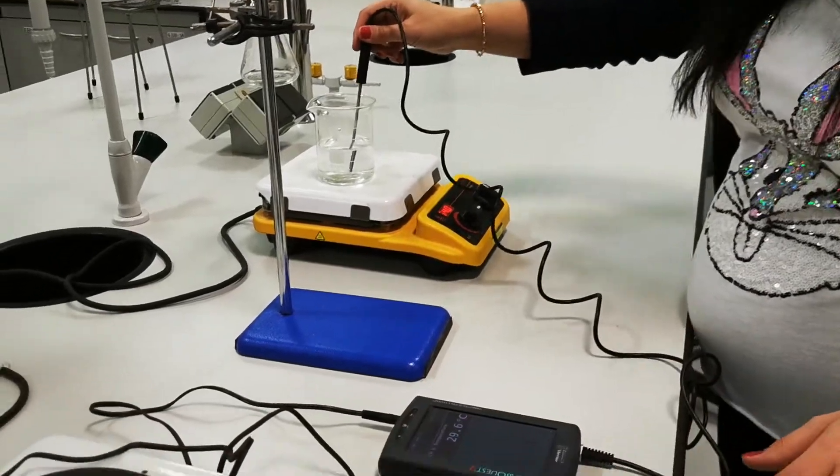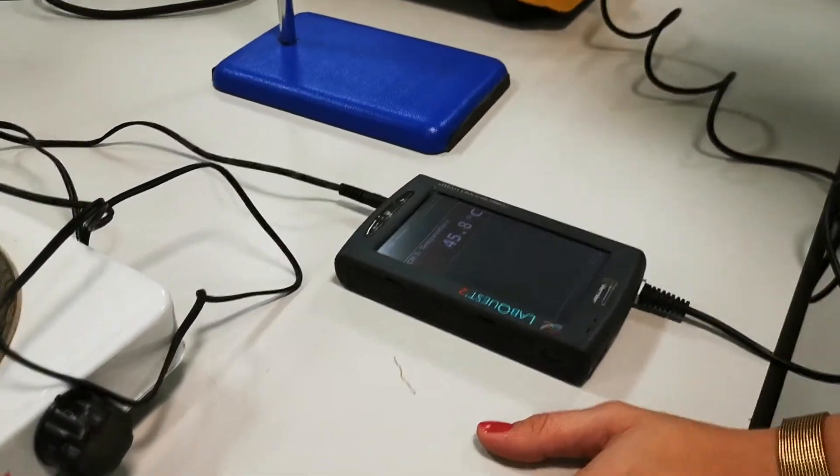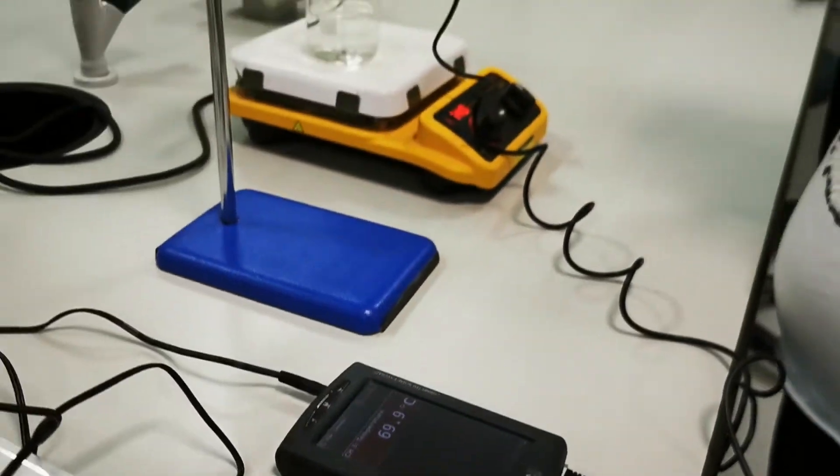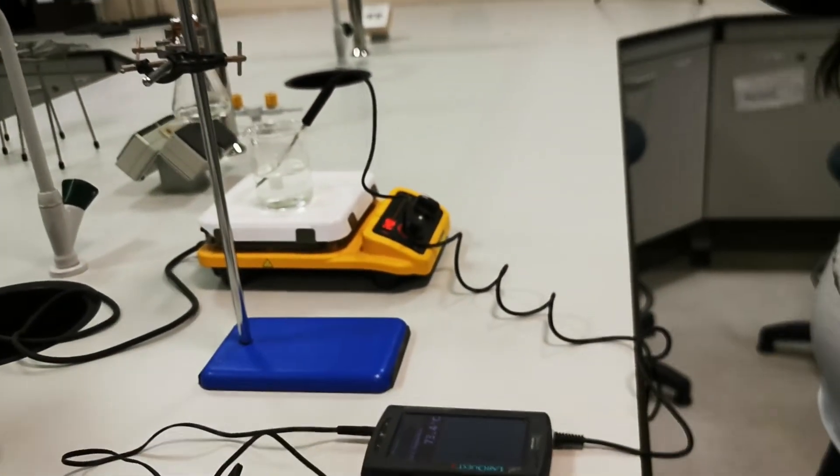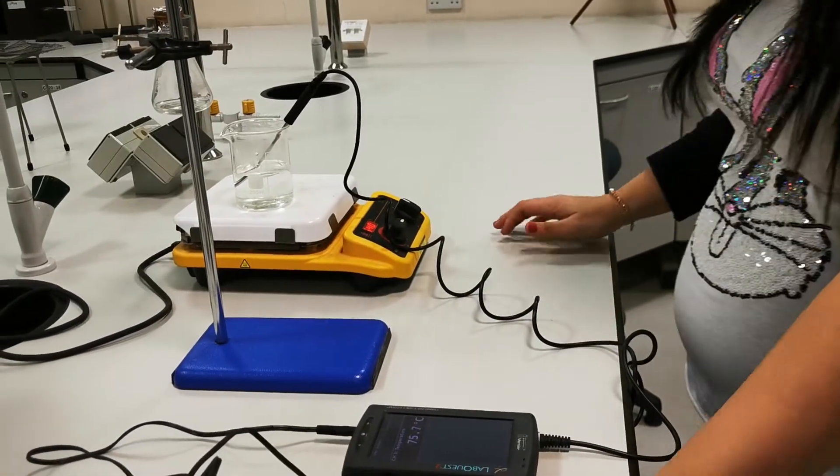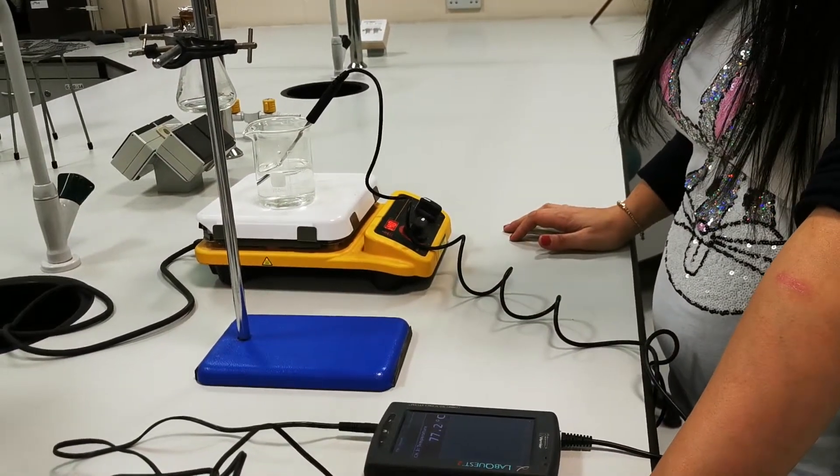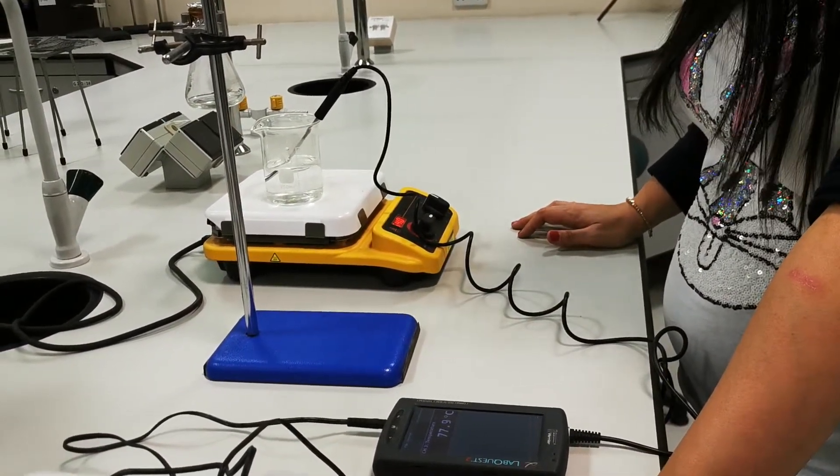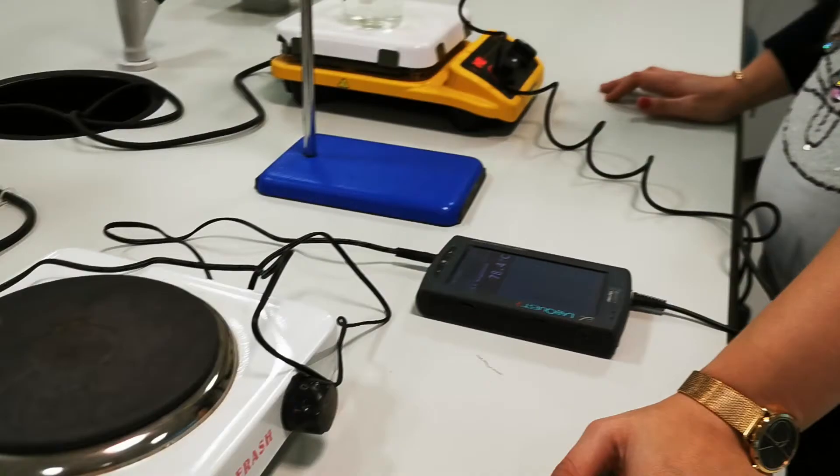Right now, the temperature is... So, definitely, it did not reach 100 degrees Celsius. The temperature is still below 100 degrees. Right now, it's about 78 degrees Celsius. So, I'm going to wait a little bit more.